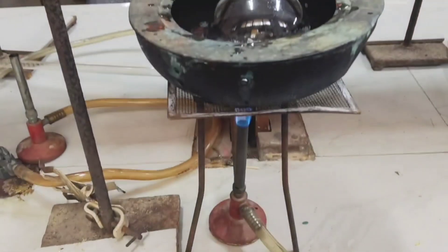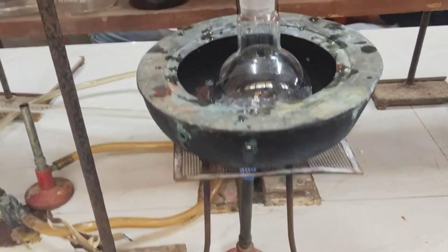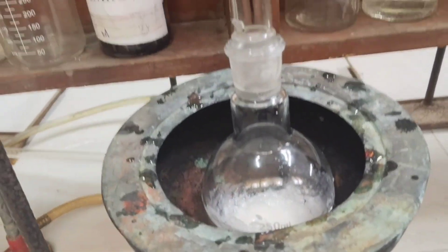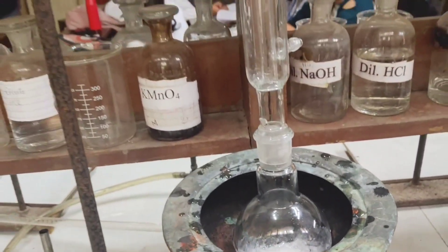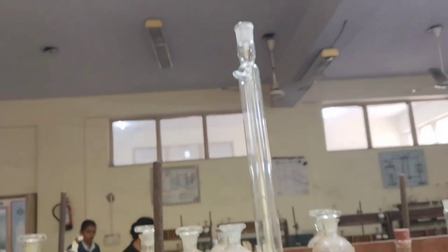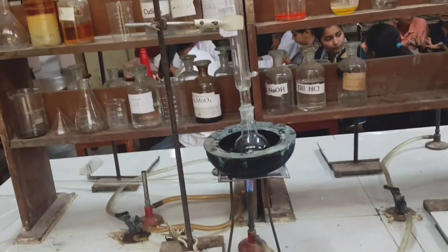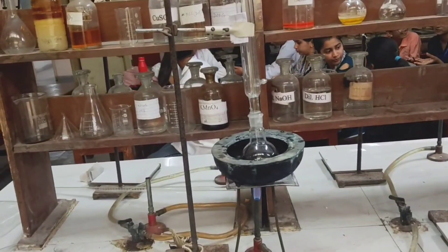Now the round bottom flask containing the mixture will be fitted with a condenser. This condenser will be supported by a special clamp and this entire setup will be heated in a water bath for about 30 minutes.